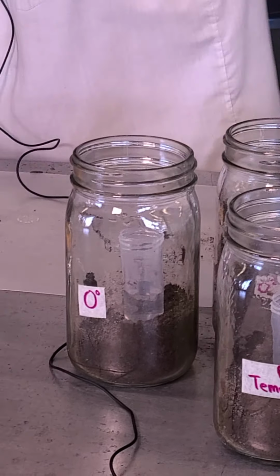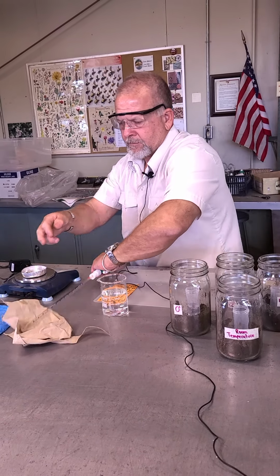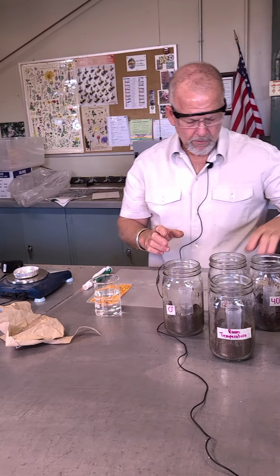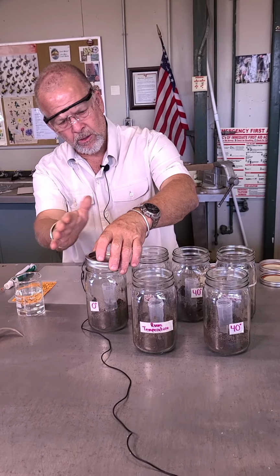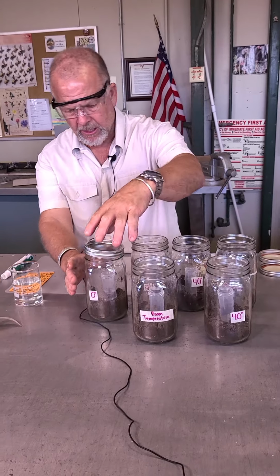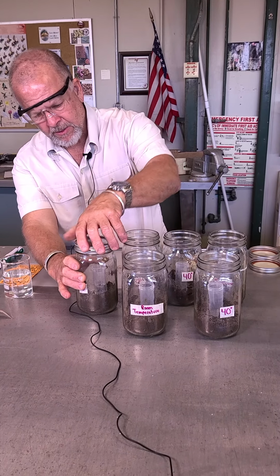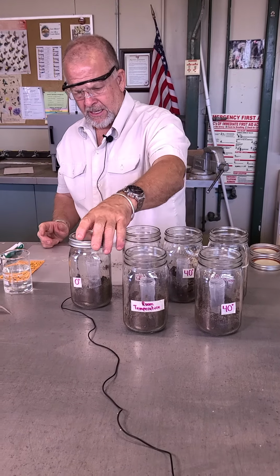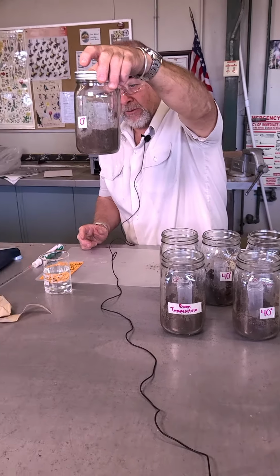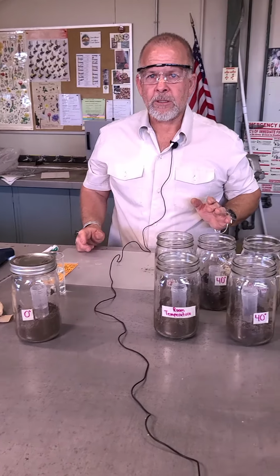Okay, so now what we're going to do is, that's just one. There's no soil around the outside edges of these. We've been very careful. We've got no other real source of contamination. These mason jar lids are good. I'm going to seal them on. They're pretty tight like that. They should be. Yes, it could fall over, but I'm going to assume that it's not going to fall over. And there we have one microcosm ready to go.